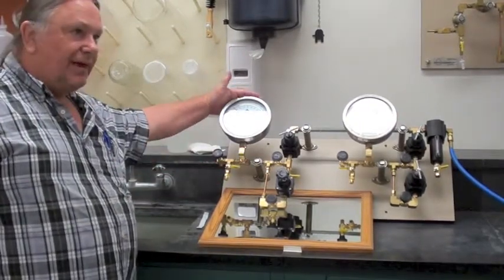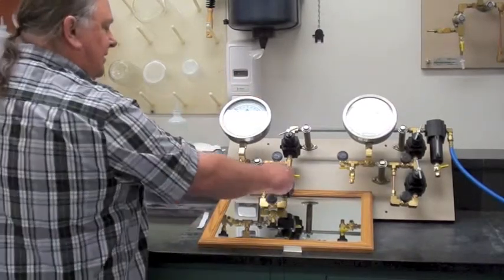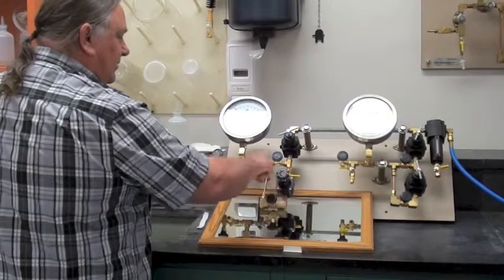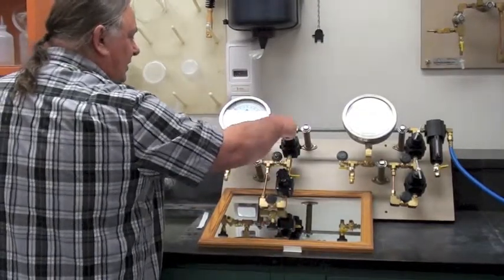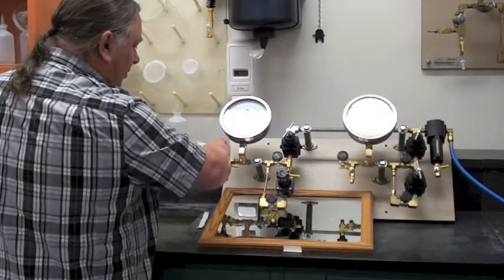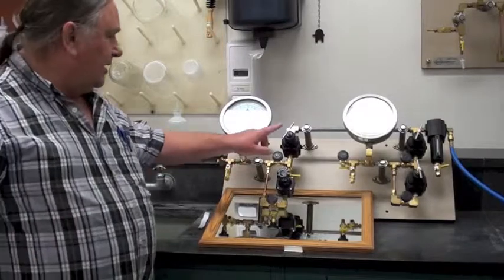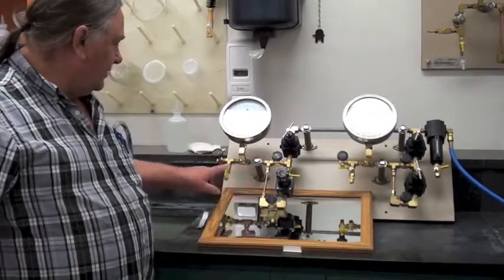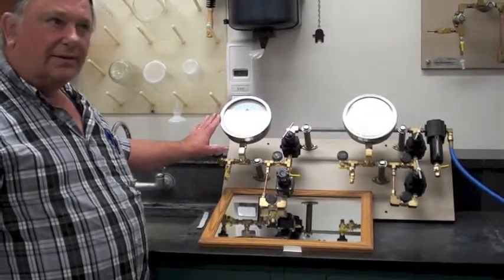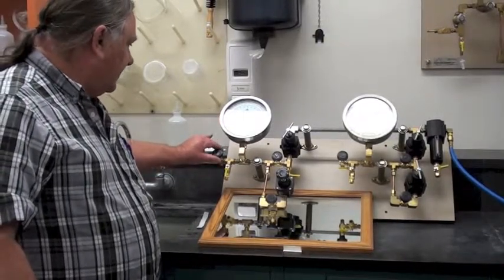Whenever you walk up to a manifold, the first thing you want to do is go to the zero point. Zero point is off, close, close, off, we'll exhaust the air, open, open. So this is a zero point, the safe point. Off, off, close, close, open, open, all the way to zero. Okay, the next thing we'll do is get ready to do something.